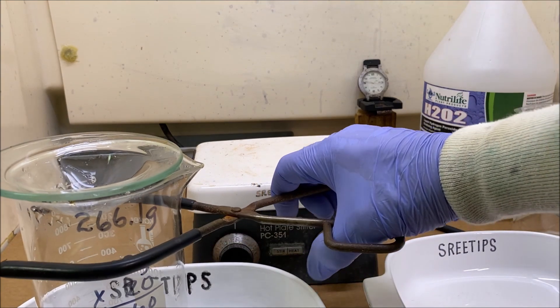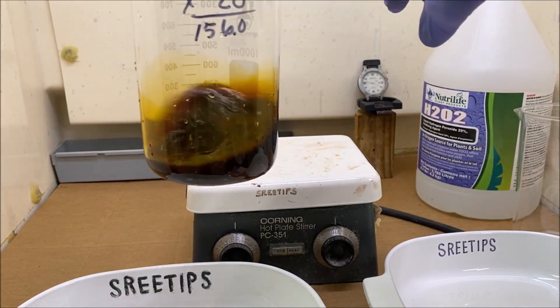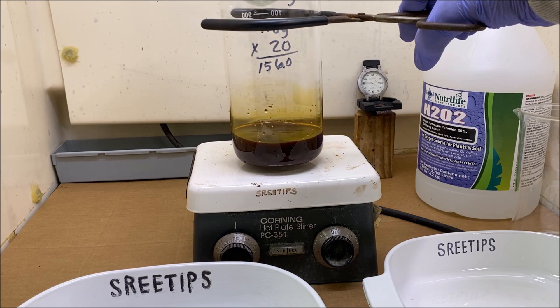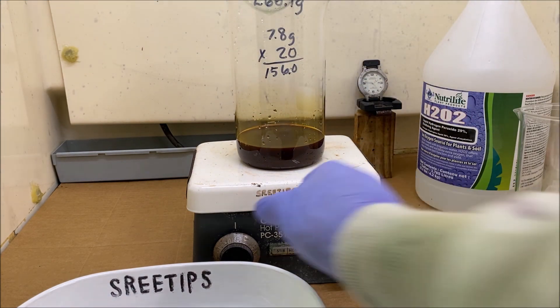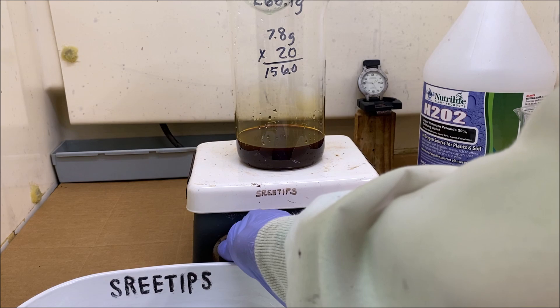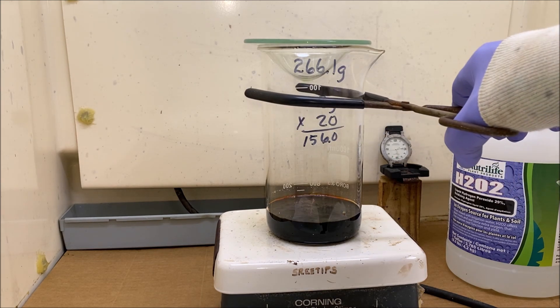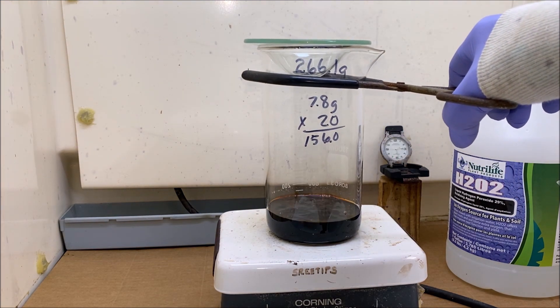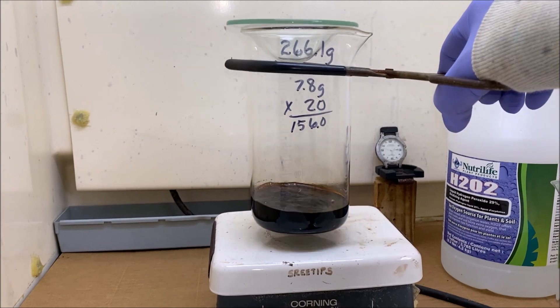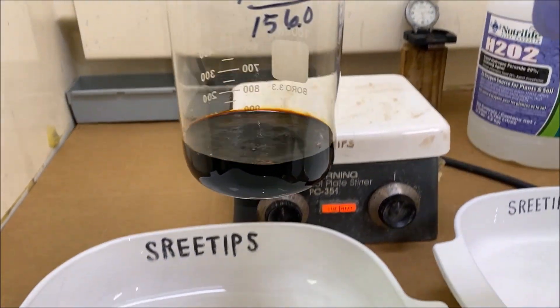Try putting it back up on the heat now. I think I've got everything to dissolve properly now. I don't think we lost anything, so I'm going to pull this down off the heat, and we're going to set it down here and let it cool off.